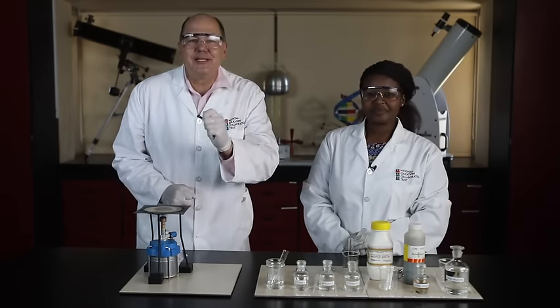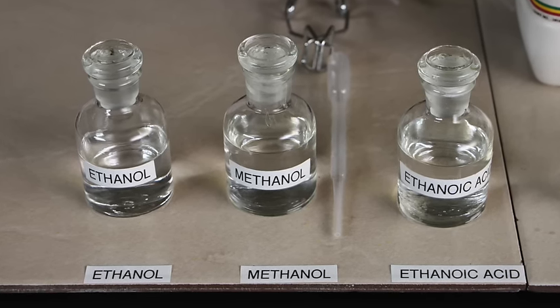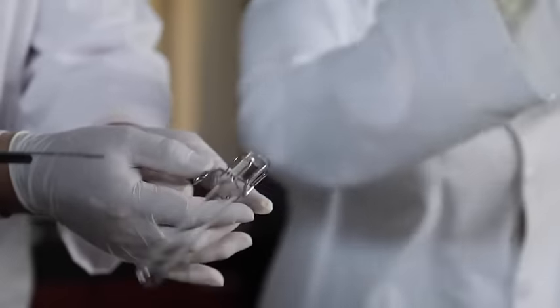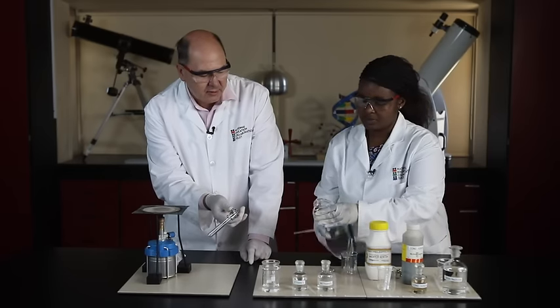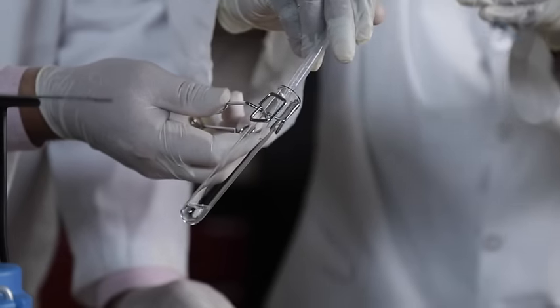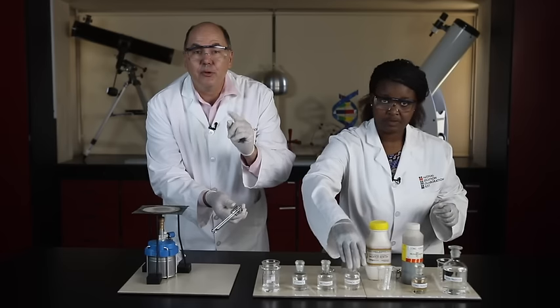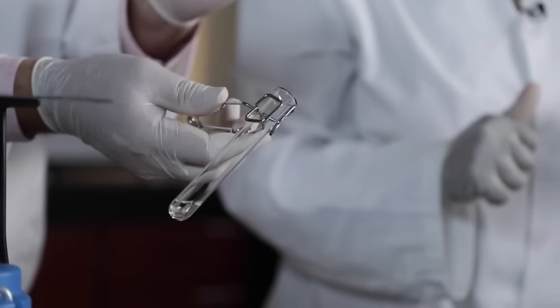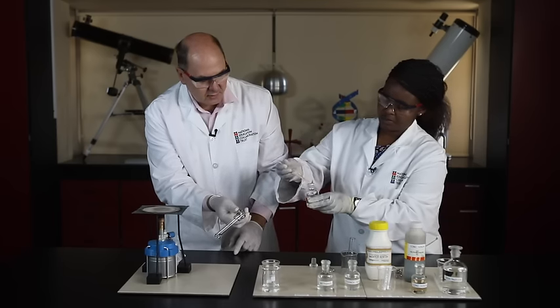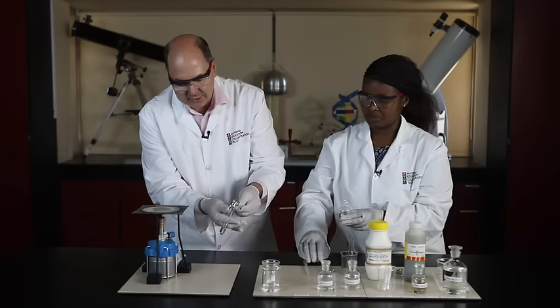Right, we are ready to make the first esters. We are using ethanoic acid reacting with ethanol in this first investigation. Let's get our test tube ready and we are going to add 2ml of ethanoic acid to this test tube. There we go, beautiful. Now ethanoic acid smells just like vinegar. That's important to take note. Next we are going to take 20 drops of ethanol, and it's about 2ml of the ethanol into the test tube. Let's swirl it around.